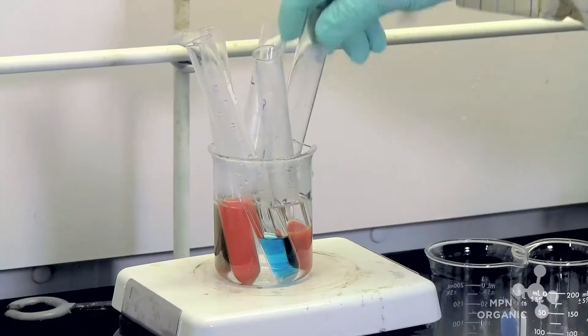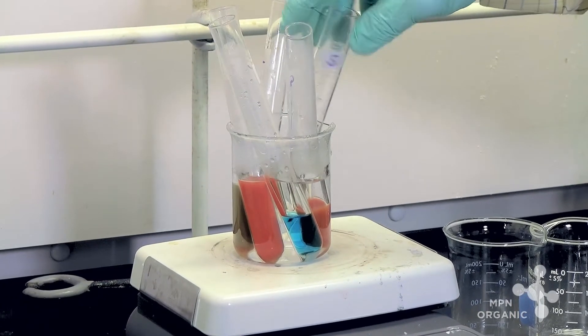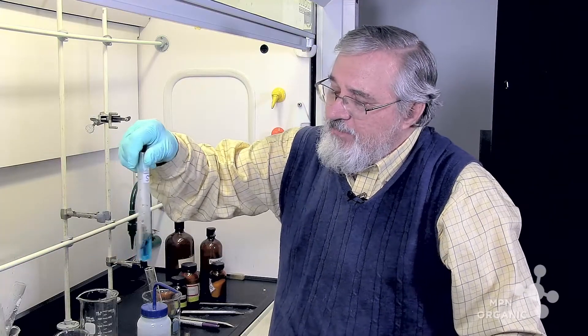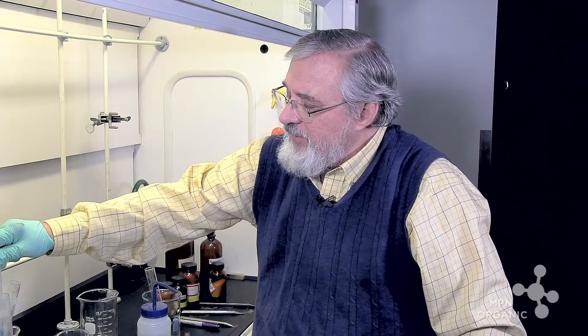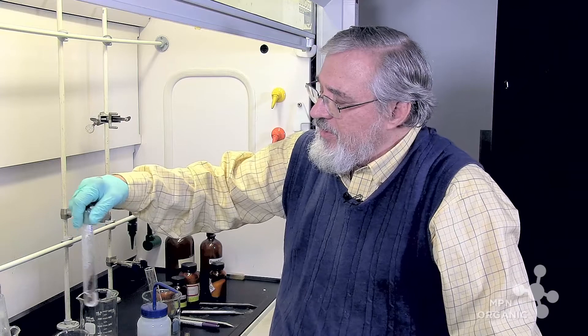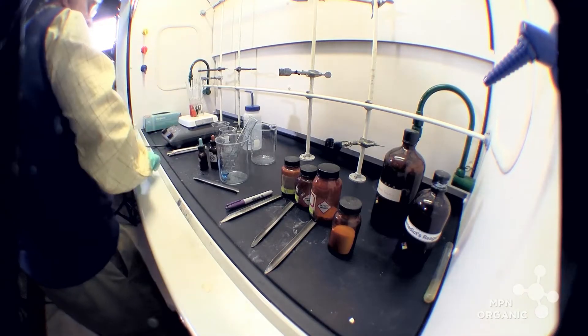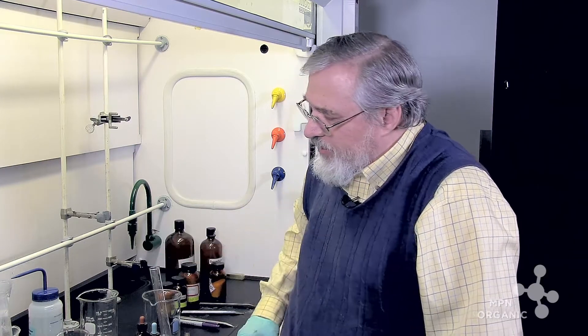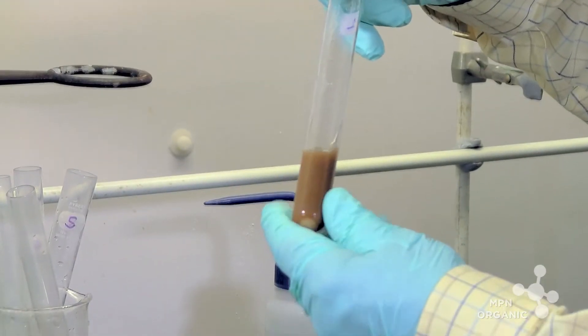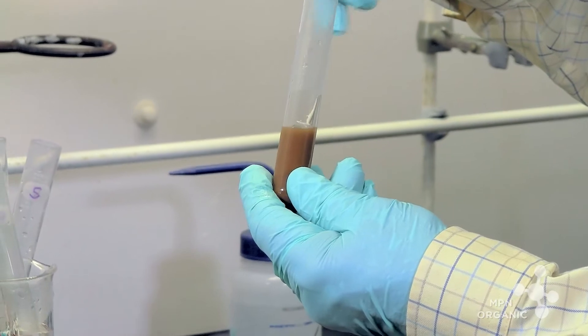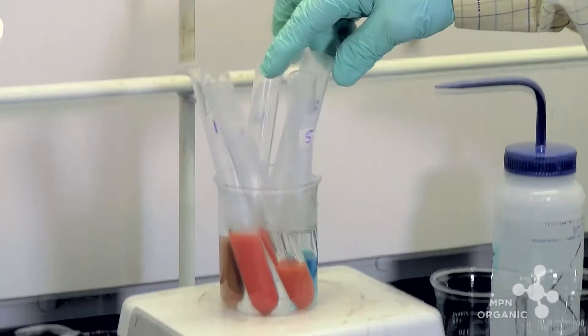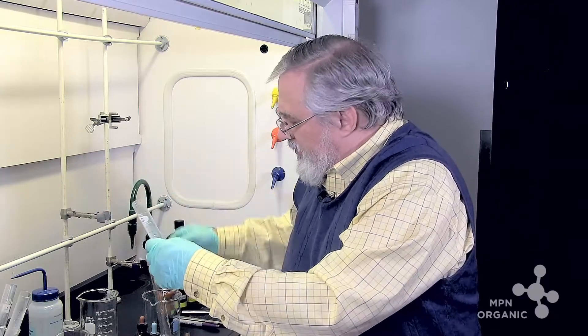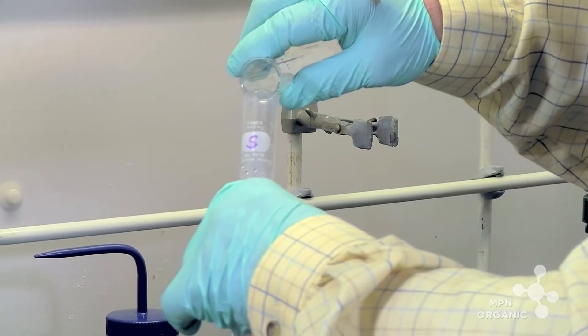And it looks as though lactose is trying to catch up and it will indeed catch up. Now what I'm going to do, I'm going to heat up the sucrose that does not have any Benedict's in it. You can see the sucrose from the treatment with Benedict's is not changing color at all. And here we have sucrose. Let's let that go for a minute. Well, see the lactose is starting now to very clearly indicate that it's reducing the copper two plus blue ion to the copper one oxide, which is a reduction. And still the sucrose resists change.